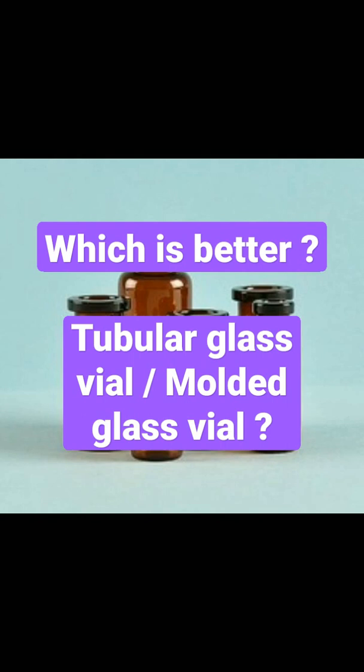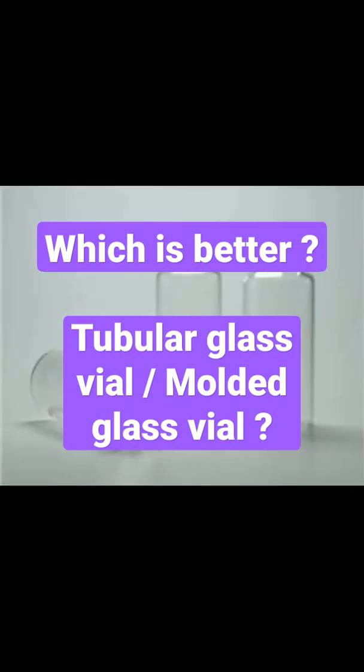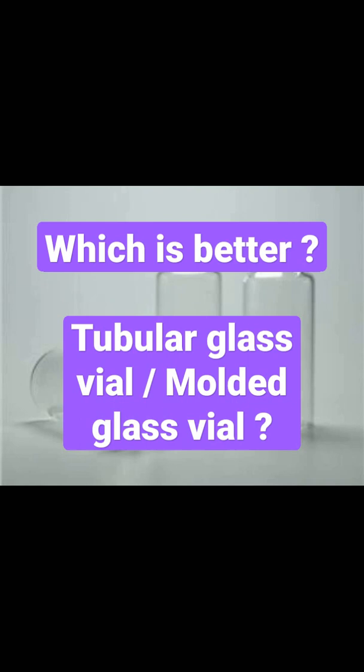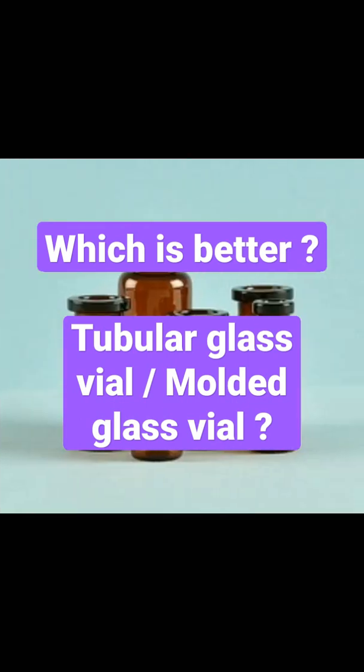Due to challenges in their respective manufacturing processes, tubular glass vials tend to be priced lower for smaller vial sizes, whereas molded glass vials become cheaper for larger vial sizes around 20 ml and above.